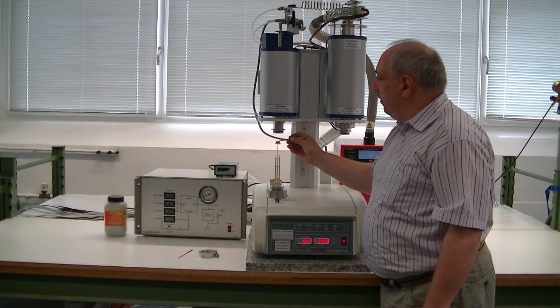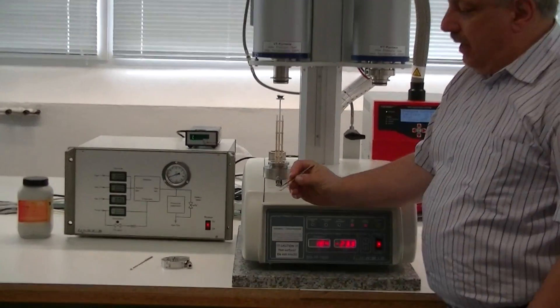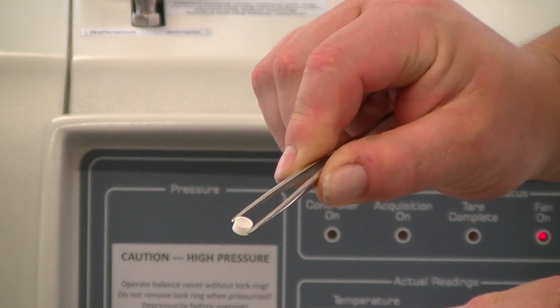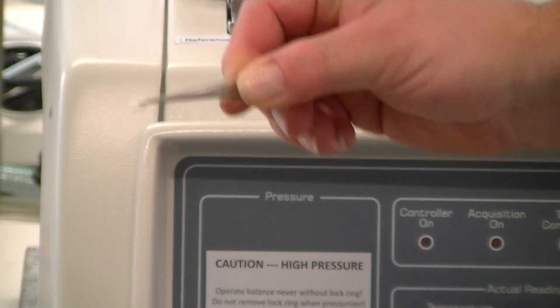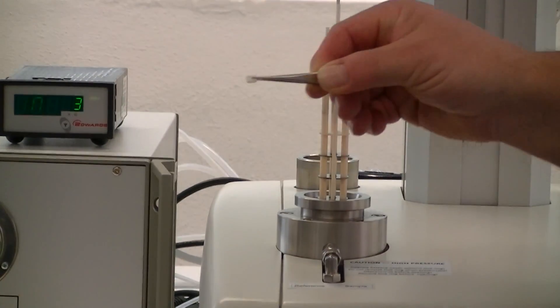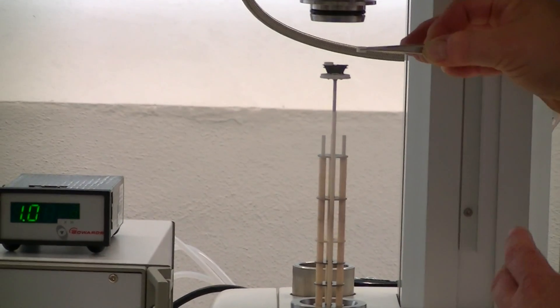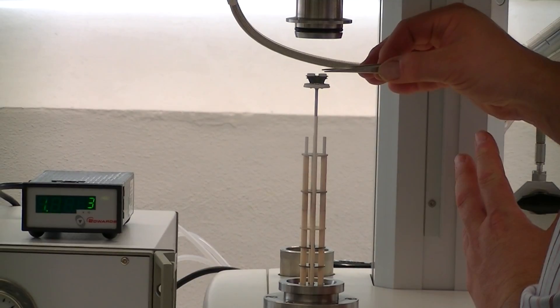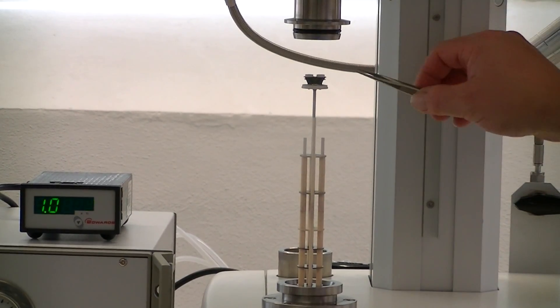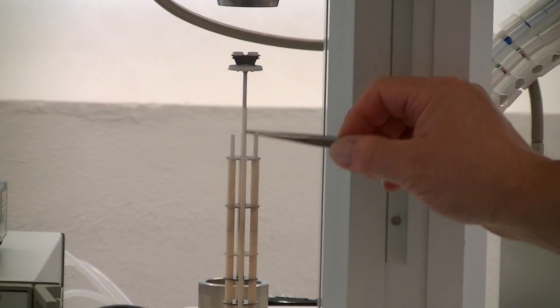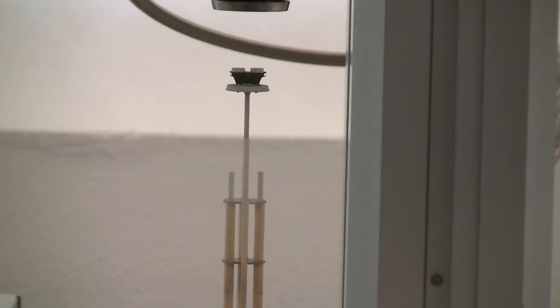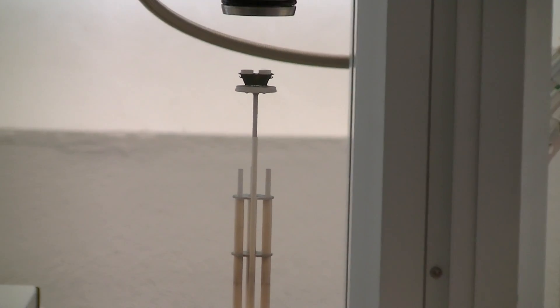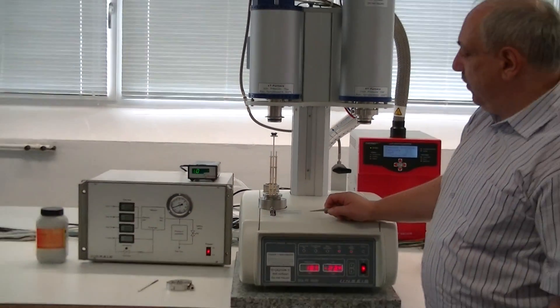You remove the crucible. Insert your sample into the crucible. The size is about 100 microliters for this size of crucible. You weigh the sample before on your micro balance in the lab. Then you place the crucible onto the measuring system. When the sample is on the measuring system, the reference side is empty. These are heat shields to avoid radiation and air circulations. We can close the furnace and then we can operate the gas and vacuum procedure.